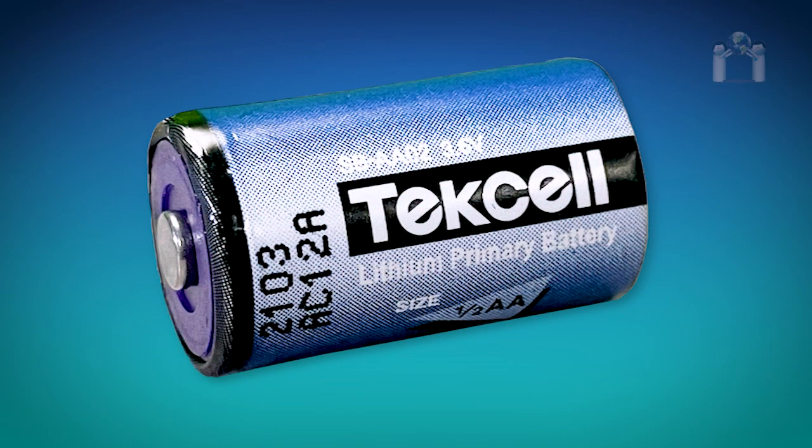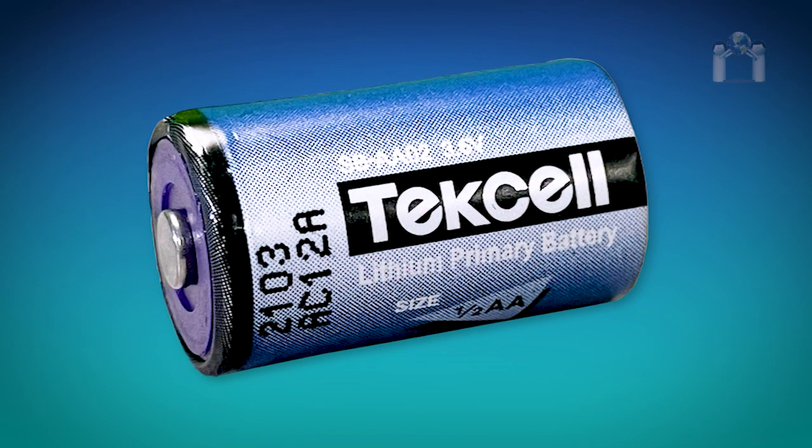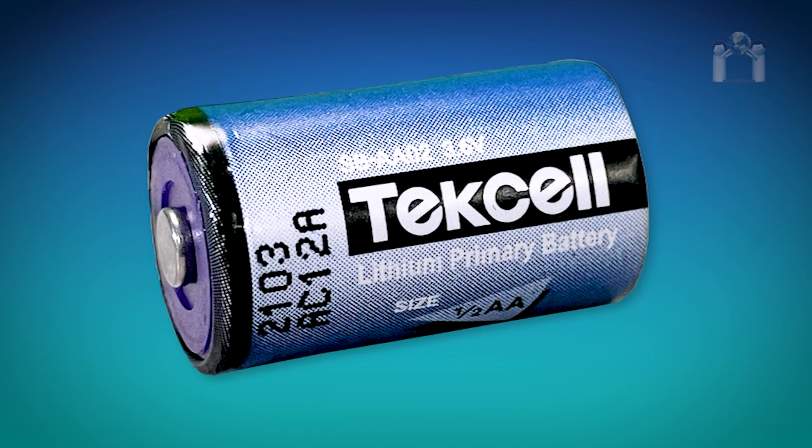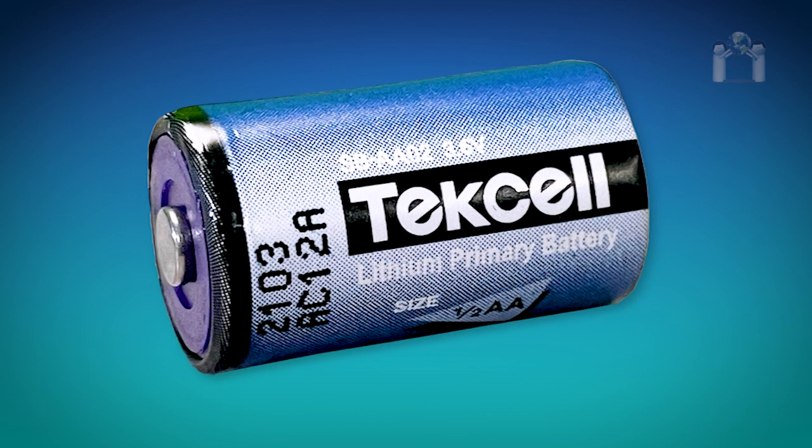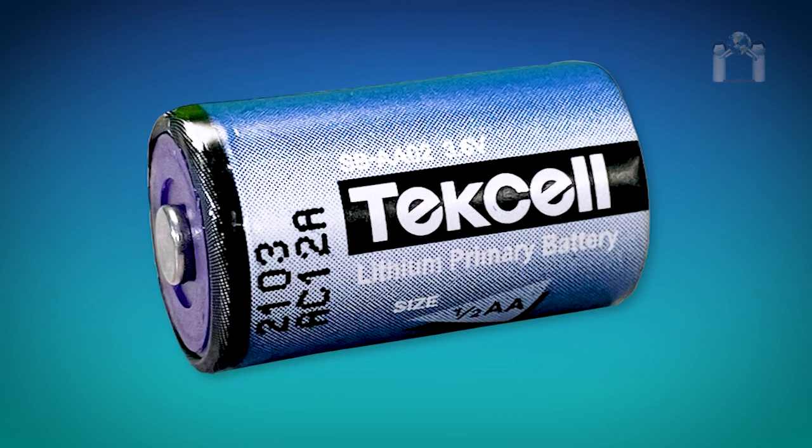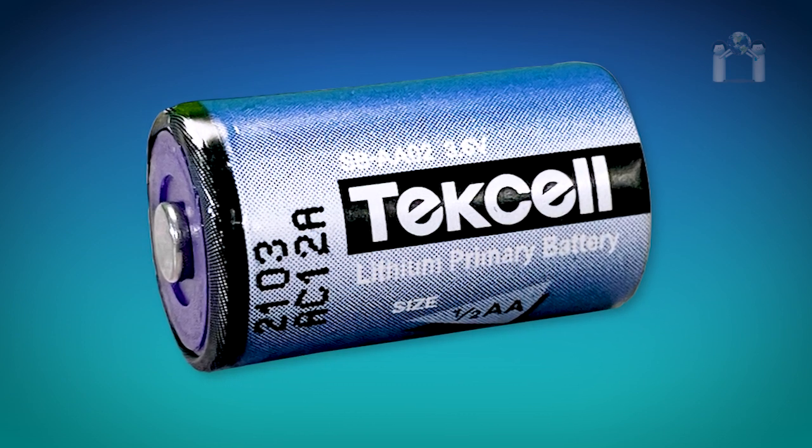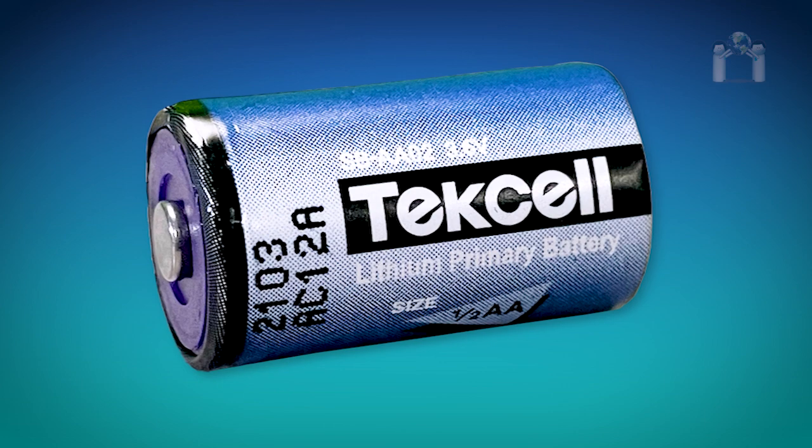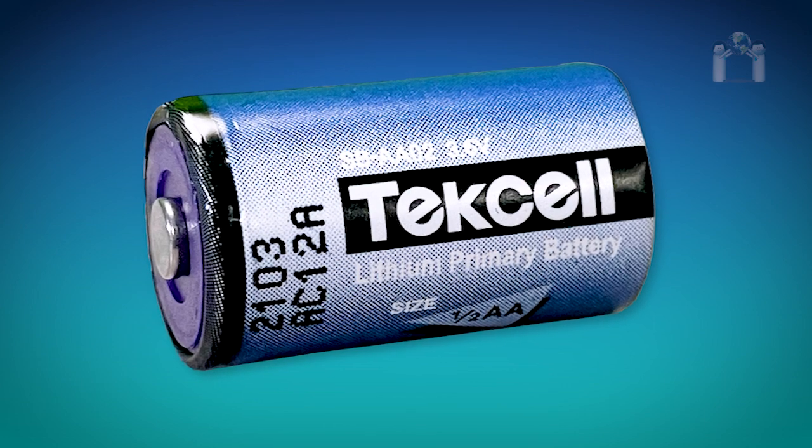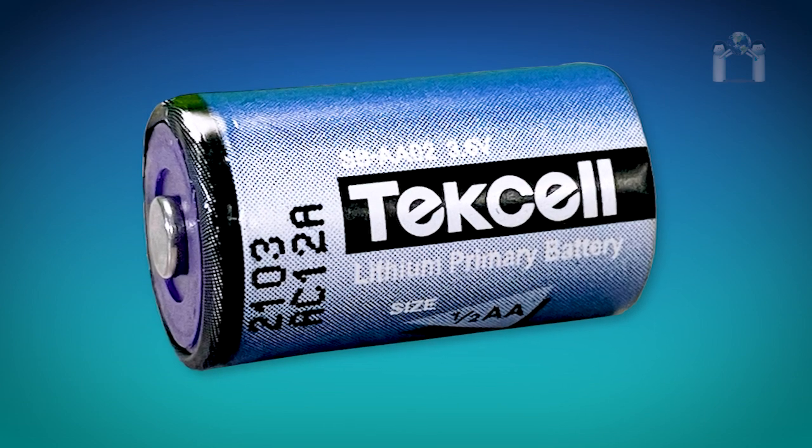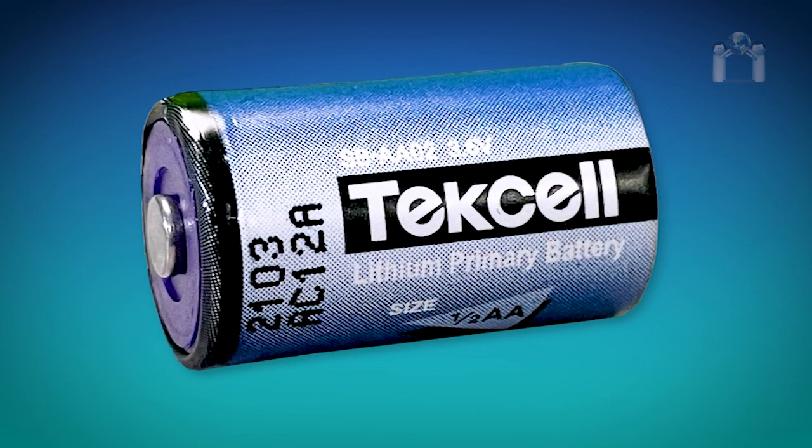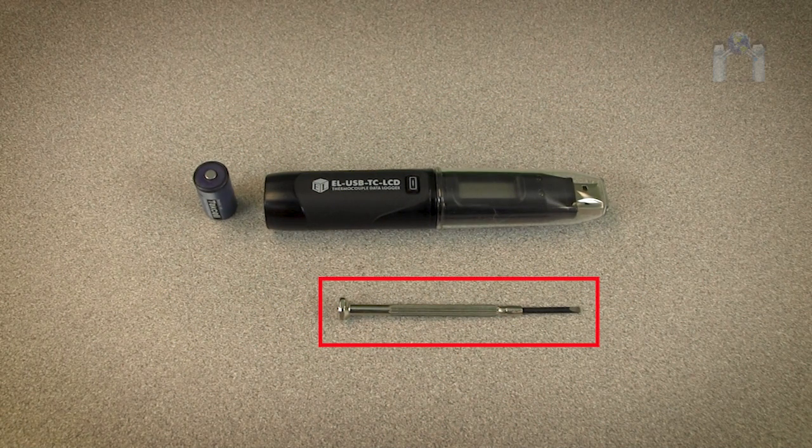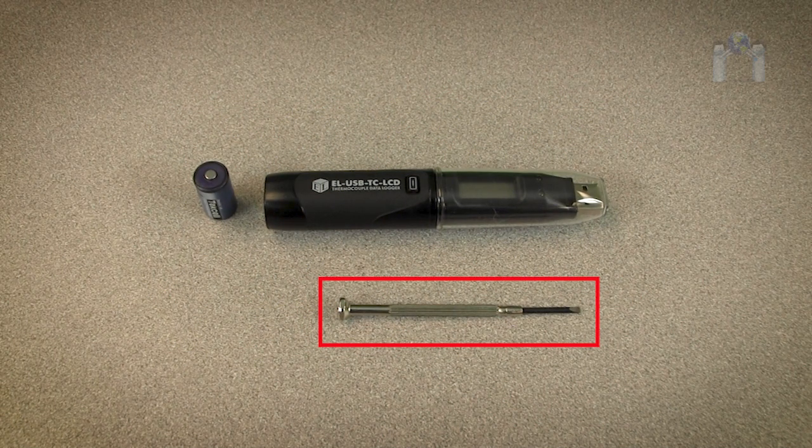To begin, let's talk about the battery. A 1 half AA battery is included and pre-installed. However, if you need to install or change your battery, you will need a small tool to remove the battery cover. I find that a jeweler screwdriver works best.